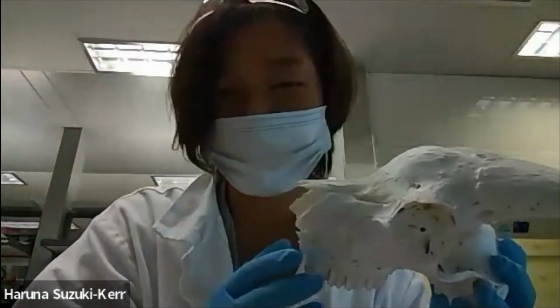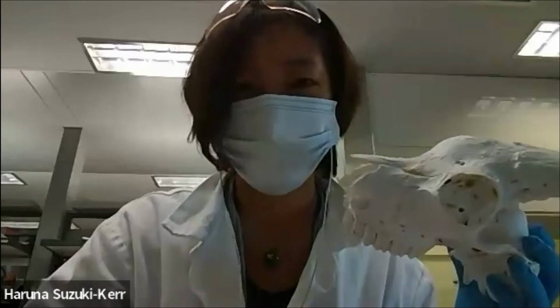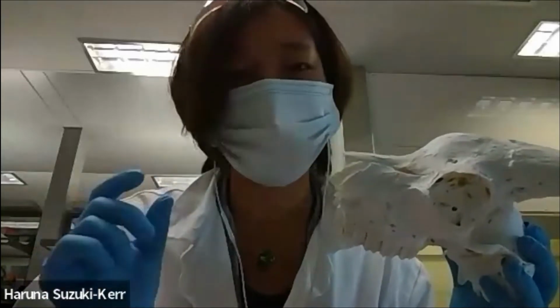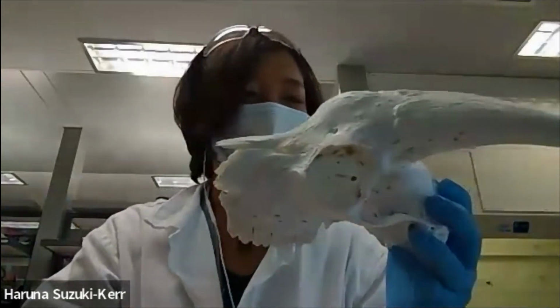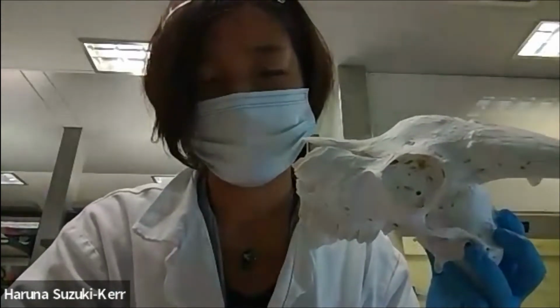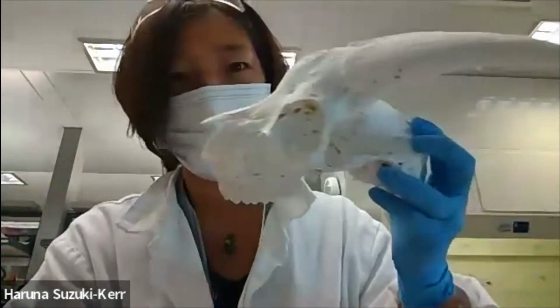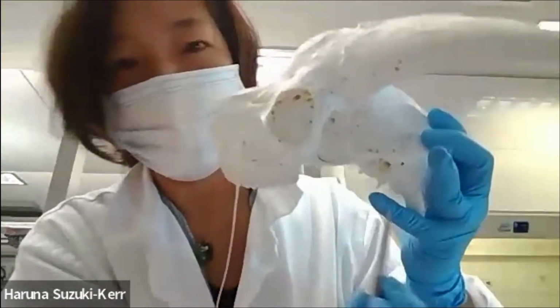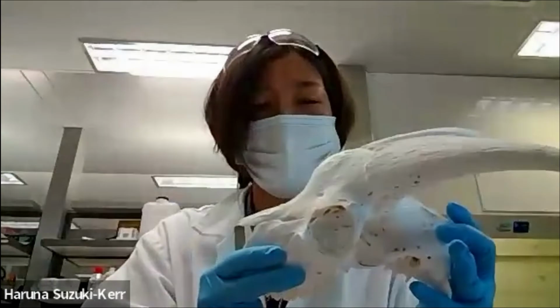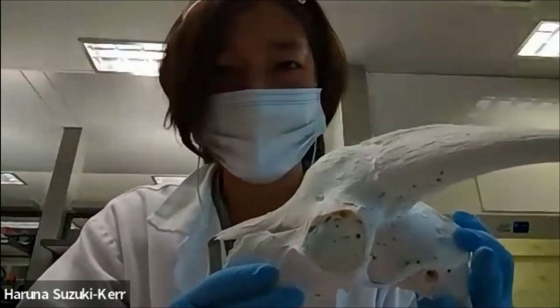Looking at the crude comparison of cochlea, goat cochlea is slightly smaller, I think 20-30% smaller than sheep from what I've seen. But obviously goats come as a different breed as well as pig. The ear canal is here, and very similar to sheep, but you can see the huge horn.